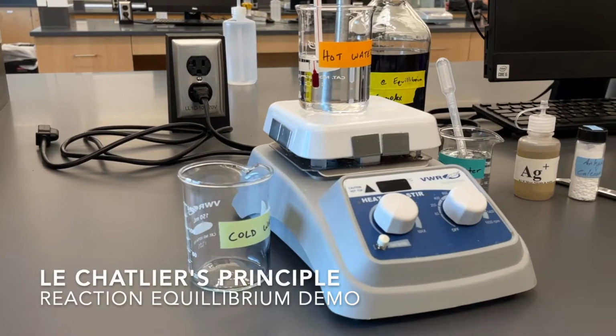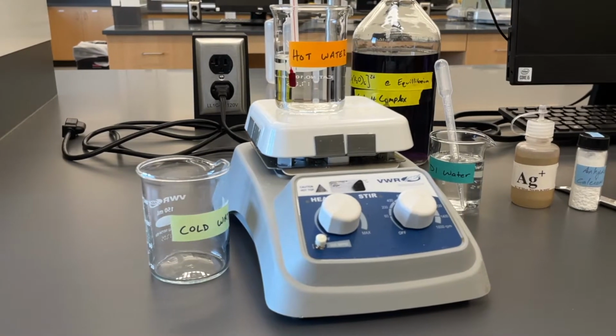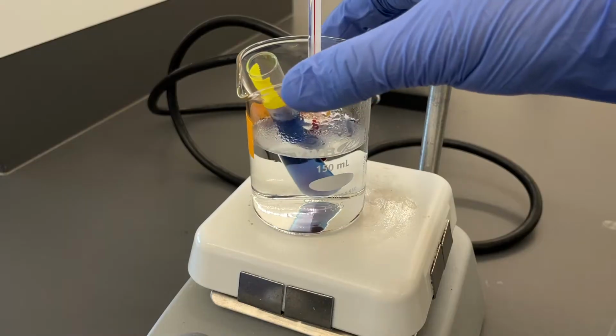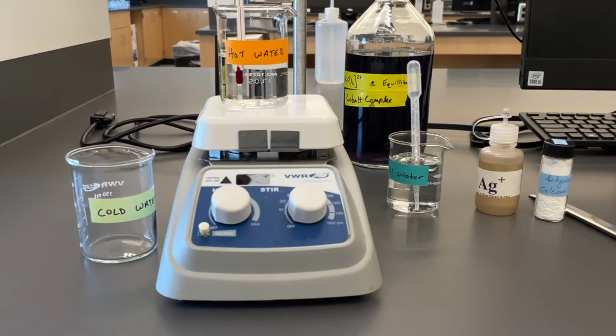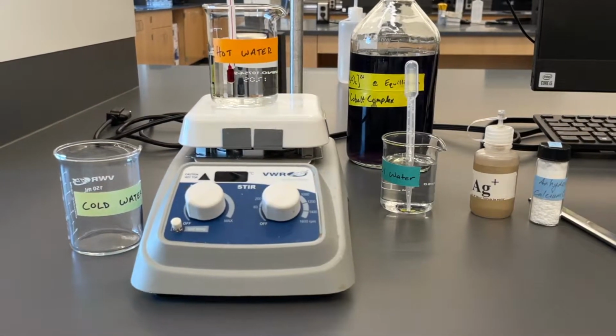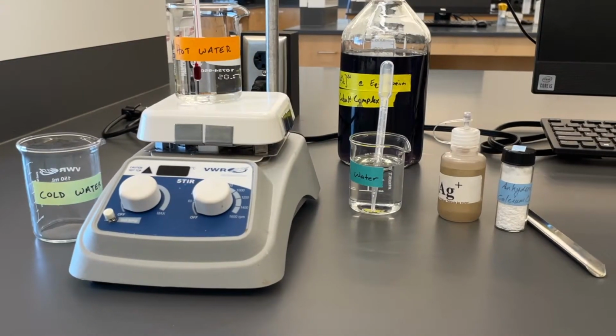In this experiment, we will work with cobalt complex ions in an equilibrium reaction. The goal is to cause disturbances to the equilibrium, shifting the reaction forward, backwards, or causing no change at all. We will use the solution's color to tell which way the reaction has shifted by applying our knowledge of Le Chatelier's principle to predict these reaction shifts.